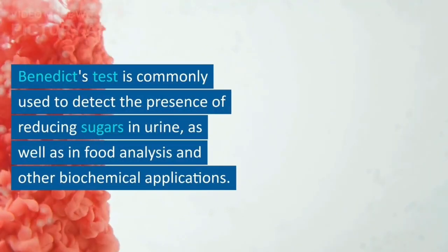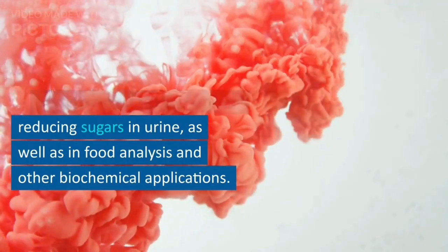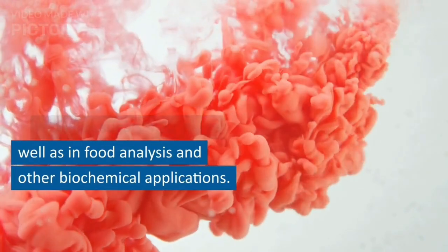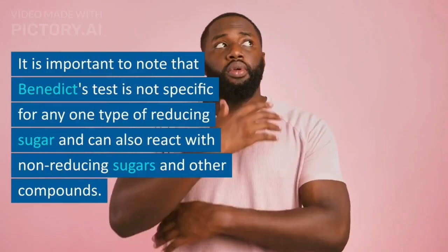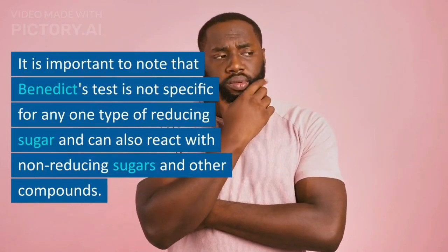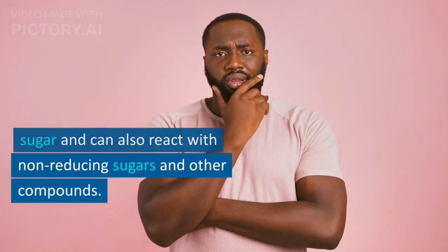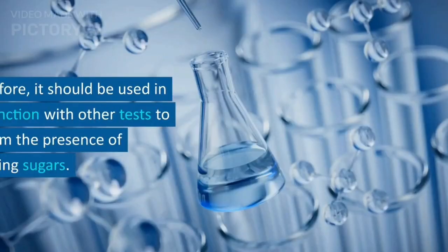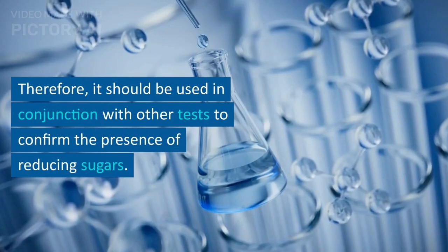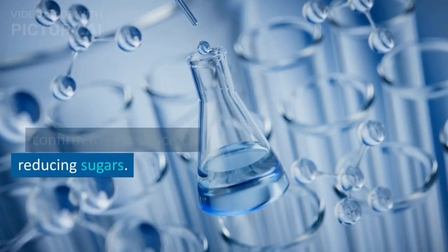Benedict's test is commonly used to detect the presence of reducing sugars in urine, as well as in food analysis and other biochemical applications. It is important to note that Benedict's test is not specific for any one type of reducing sugar and can also react with non-reducing sugars and other compounds. Therefore, it should be used in conjunction with other tests to confirm the presence of reducing sugars.